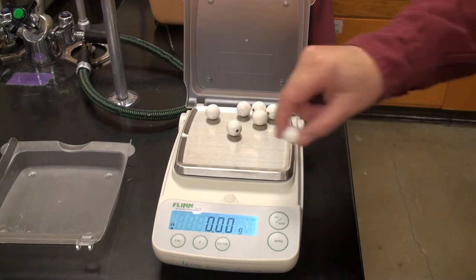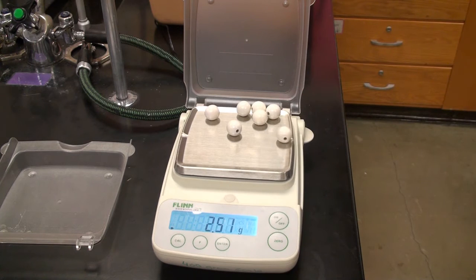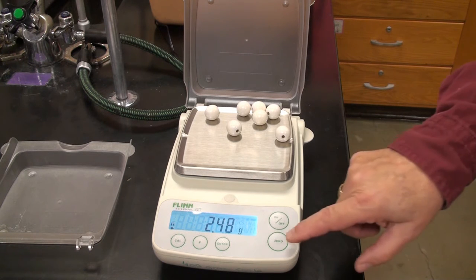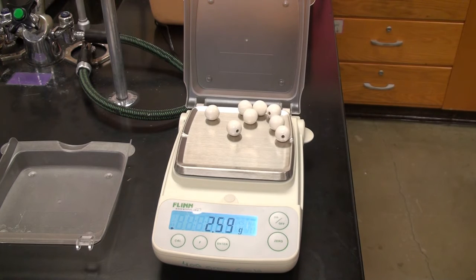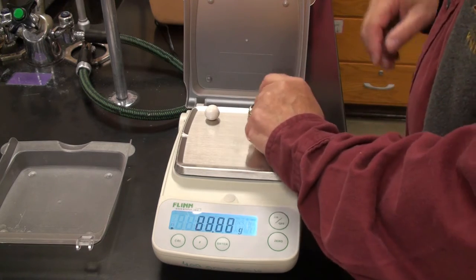Zero it. Here's the seventh one. Zero it. Here's the eighth one. Okay, I'm going to stop with those.